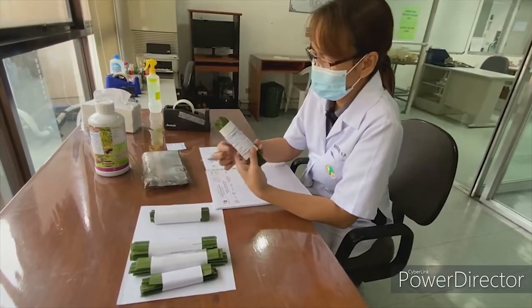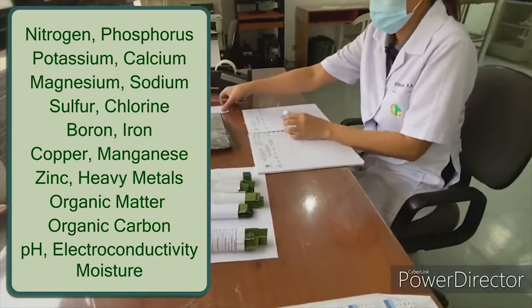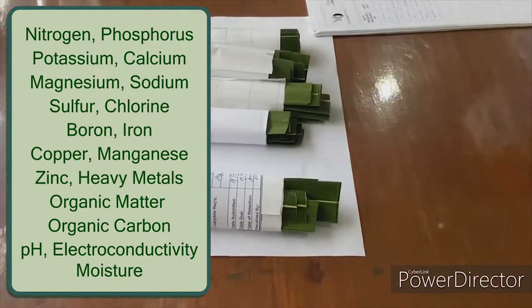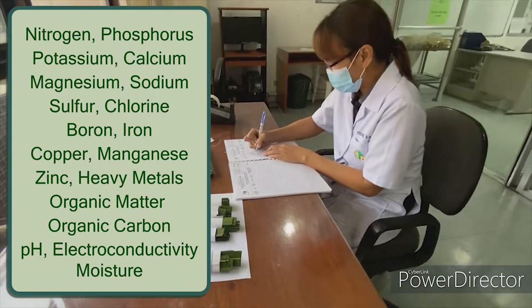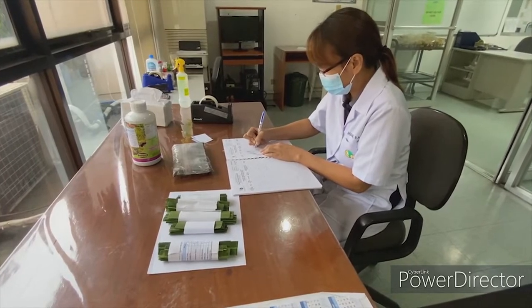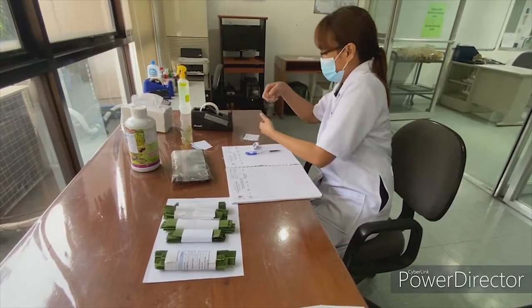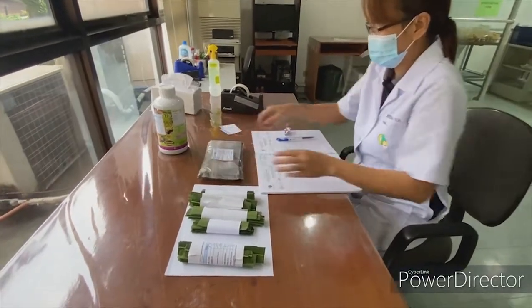The recommended parameters for testing are nitrogen, phosphorus, potassium, calcium, magnesium, sodium, sulfur, chlorine, boron, iron, copper, manganese, zinc, heavy metals, organic matter, organic carbon, pH, electroconductivity, and moisture content. During sample receiving, a unique laboratory code is assigned for each sample and a corresponding sample tag is placed on the sample to ensure confidentiality and impartiality.